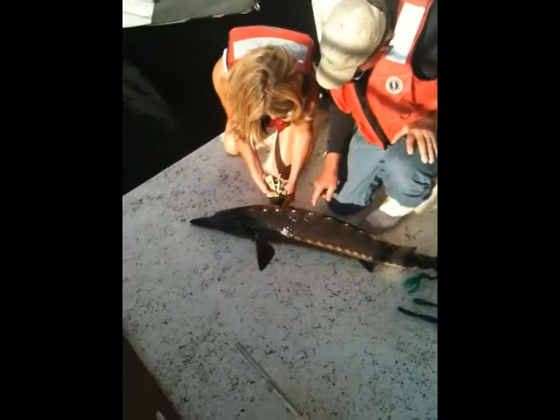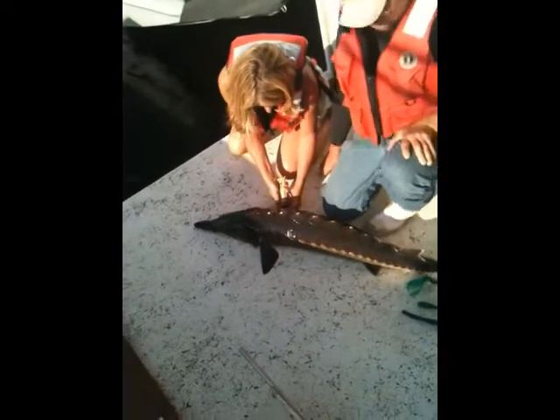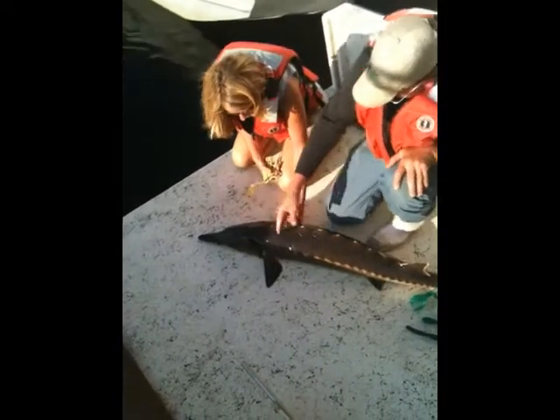If it's me — okay, it's in. Now click. Click down. And pull back out. Turn in to the other side.